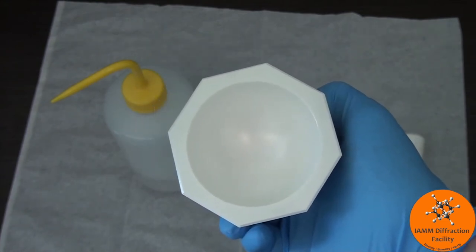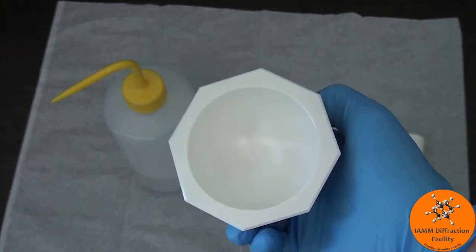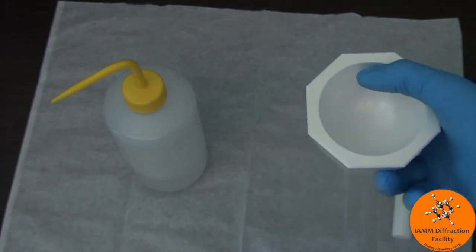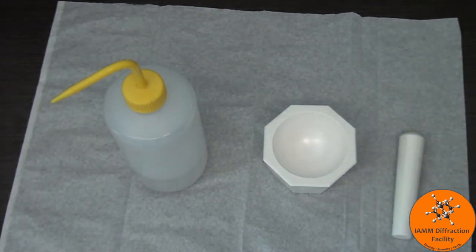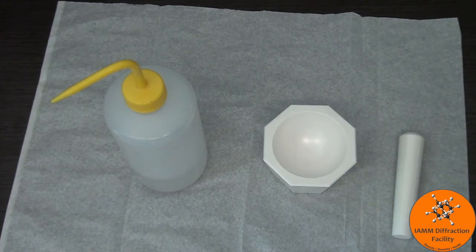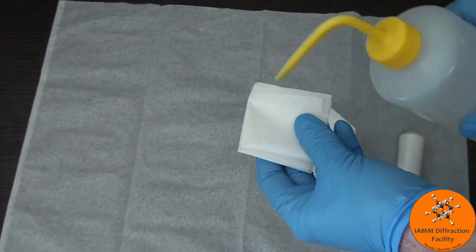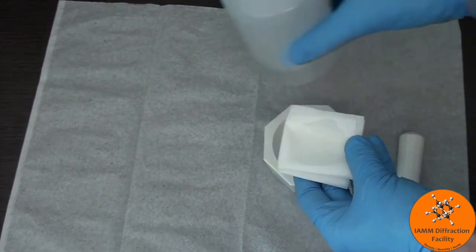At this point, after just wiping it out or trying to clean out the sand the best I can, I would just recommend that you take another Kim Wipe, wet it down with something like isopropanol, acetone, something, and then just do one final cleaning inside.